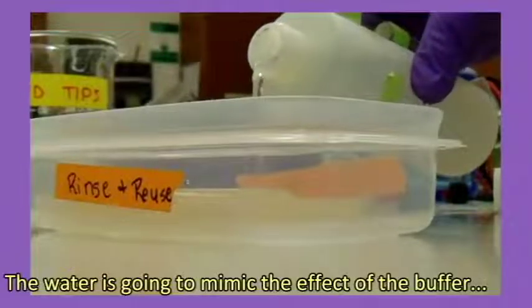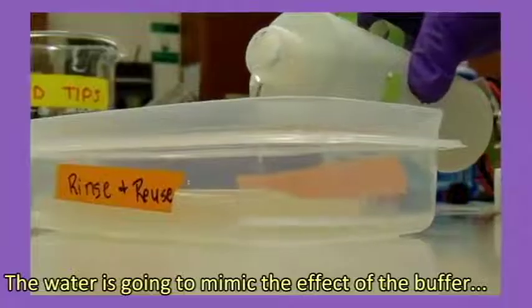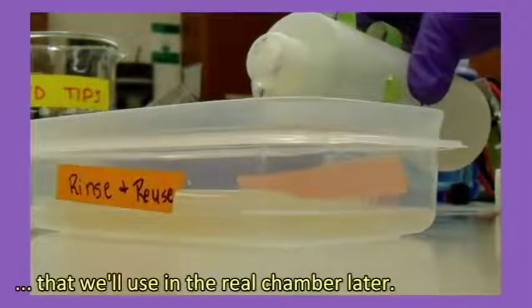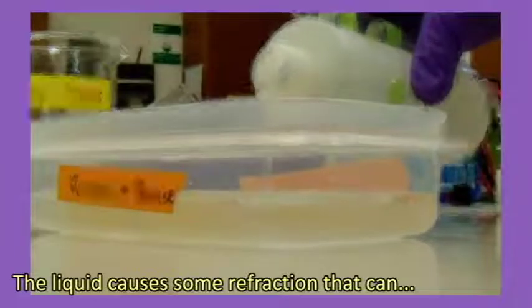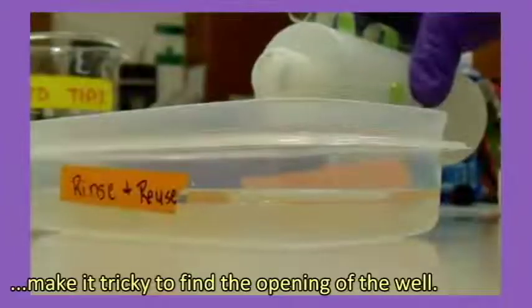The water is going to mimic the effect of the buffer that we'll use in the real chamber later. The liquid causes some refraction that can make it tricky to find the opening of the well.